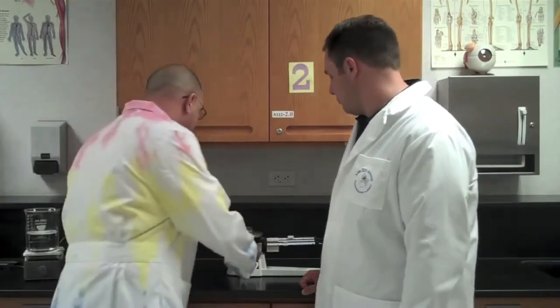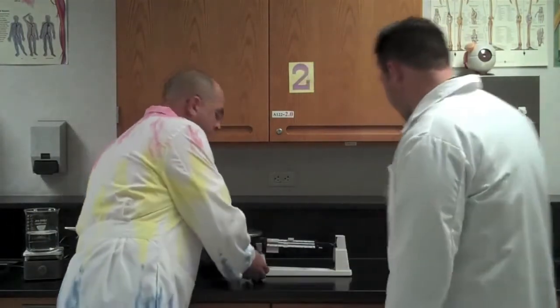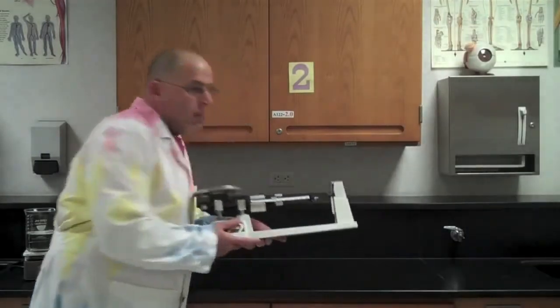However, that's the total of the petri dish and the golf ball. So to find just the golf ball, we subtract the 8 grams from the petri dish, which will give us, so 54 minus 8 is going to give us 46. So 46 grams is the mass of this golf ball. I'm going to show this up close.